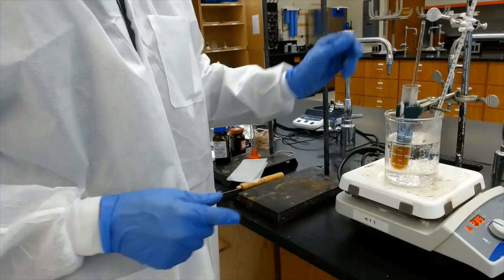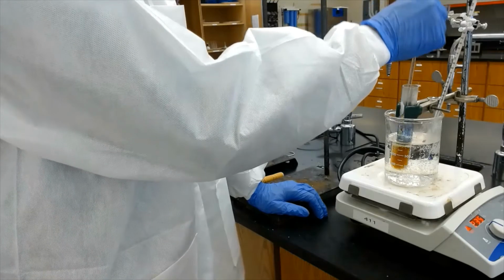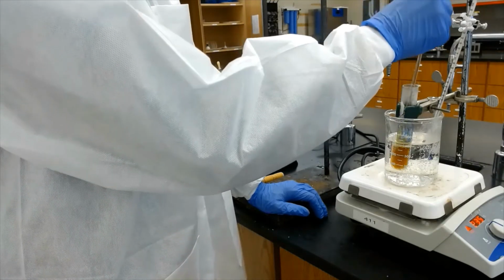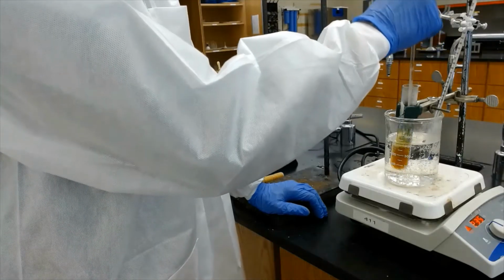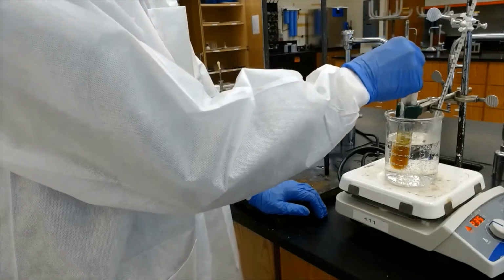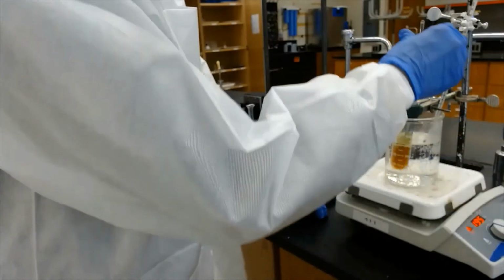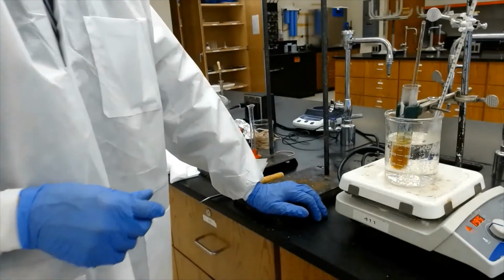If you notice, at the very top, you can see the blue here, right? That's where there is still quite a bit of oxygen. So at the surface we have a lot of oxygen, right? But inside the solution we have no oxygen because we're heating this thing. And just lower the temperature a bit. And this is exactly what we want, right?